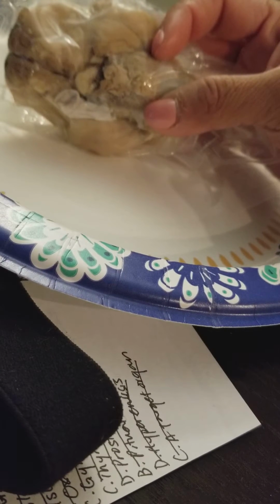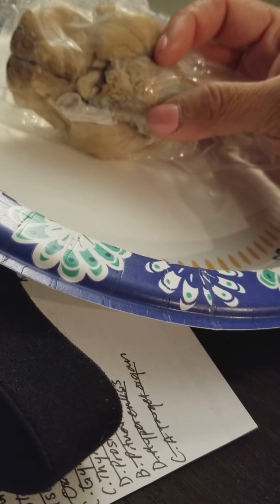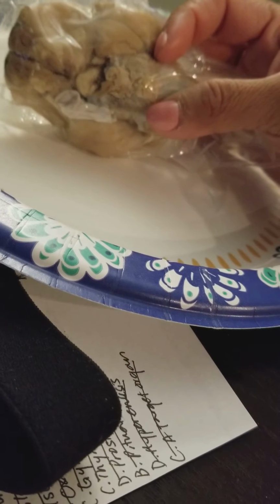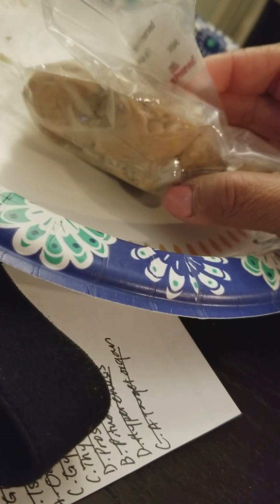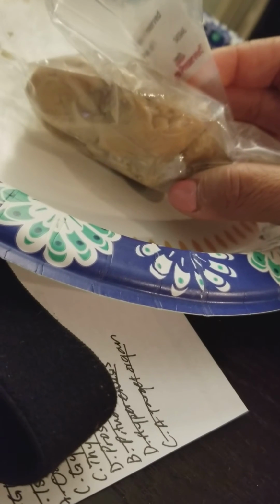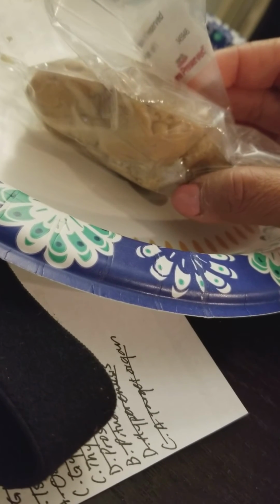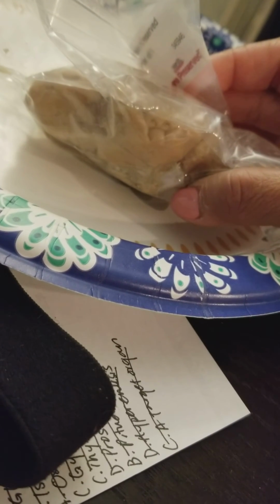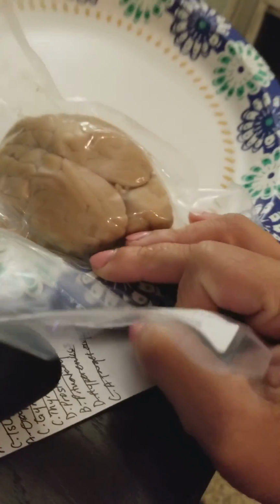And the septum, oh no, I already said that. The trochlear relates to the part of the body resembling a pulley. The abducens supplies the muscle concerned with lateral movement of the eyeballs. The pia mater is the inner layer that adheres to the brain, and the arachnoid is the middle layer holding CSF. Dura mater is the outermost tough fibrous layer that protects the brain. The meninges are the three connective tissues that cover the brain. That is my sheep brain.